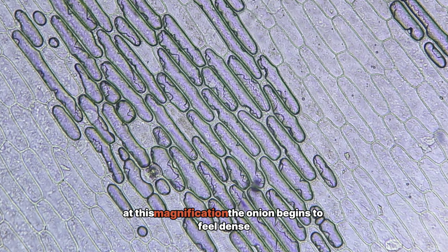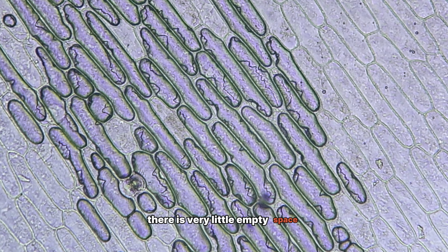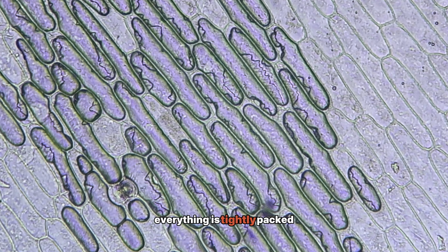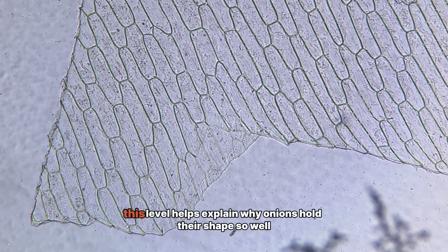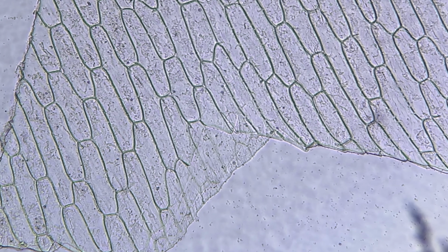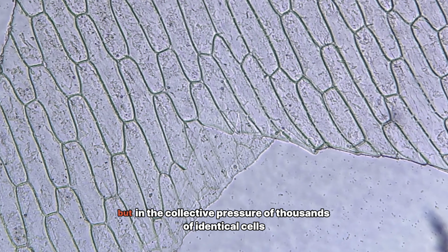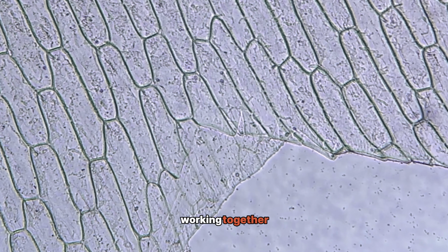At this magnification, the onion begins to feel dense. There is very little empty space. Everything is tightly packed, yet nothing looks damaged. This level helps explain why onions hold their shape so well. The strength is not in a single layer, but in the collective pressure of thousands of identical cells working together.